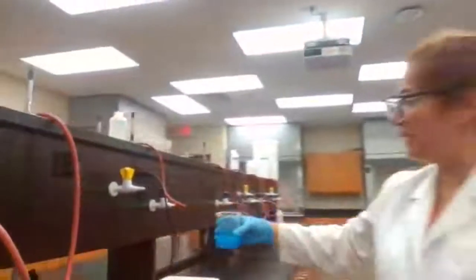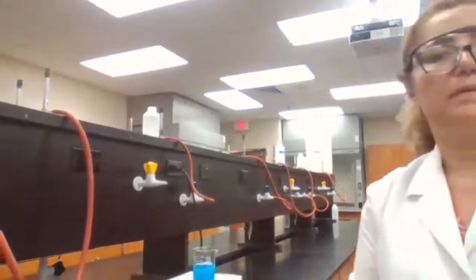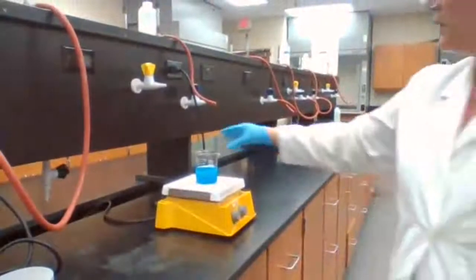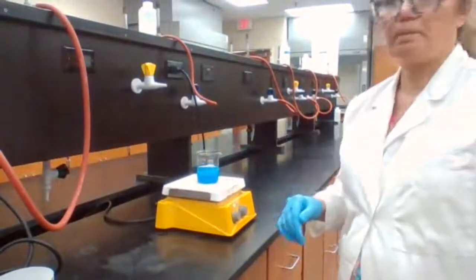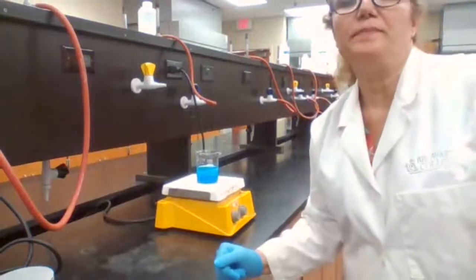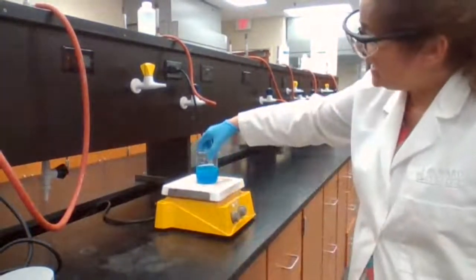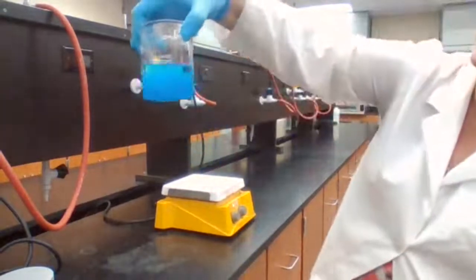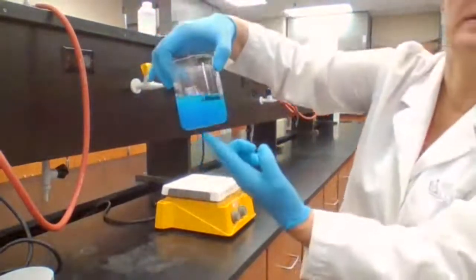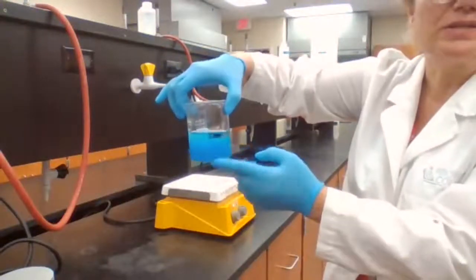We're going to place on hot plate to heat up the sample. You're going to heat up the sample. And the next step is going to be, yes, it's a darker blue color. And also the texture has changed because it's not clear liquid anymore. You have solid compound, and that solid is the copper hydroxide that has formed.